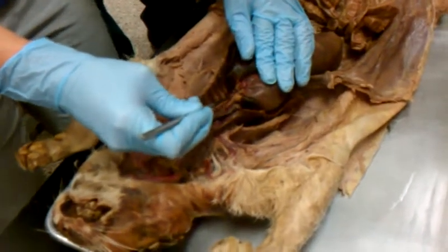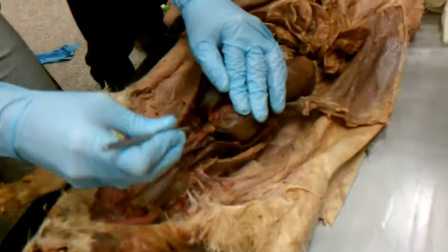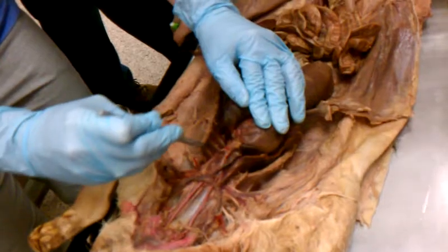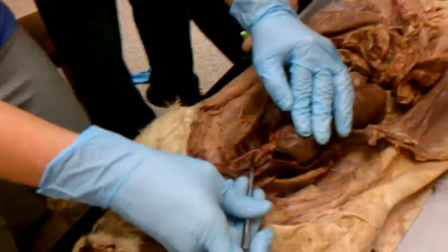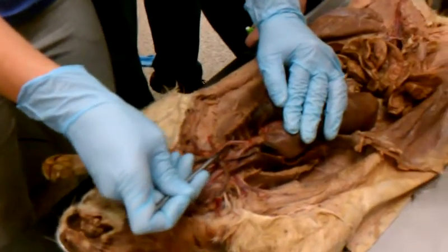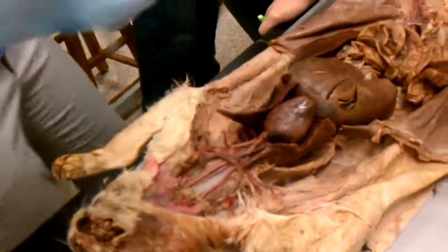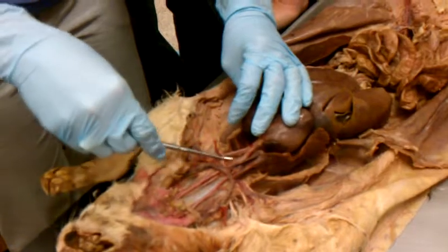So where it actually curves, that's the aortic arch. This whole thing is the aorta. Then, once you go from the aorta, you have this one and this one coming off of it. The one on the left that comes off is the left subclavian artery. And what I mean by left is, I would literally place yourself as a cat and do left and right. So the first branch on the left is the left subclavian, and then you have this branch on the right.